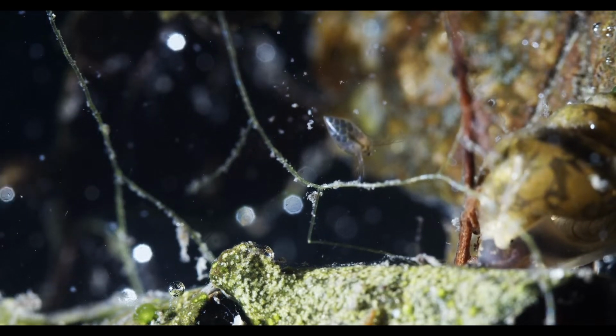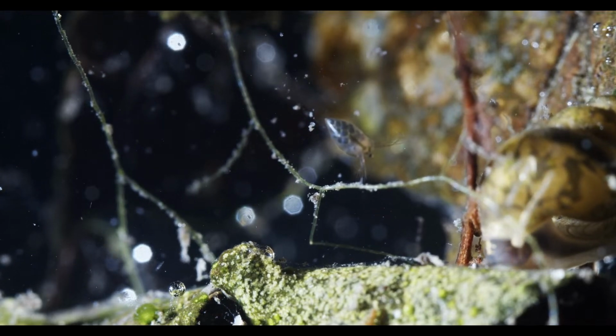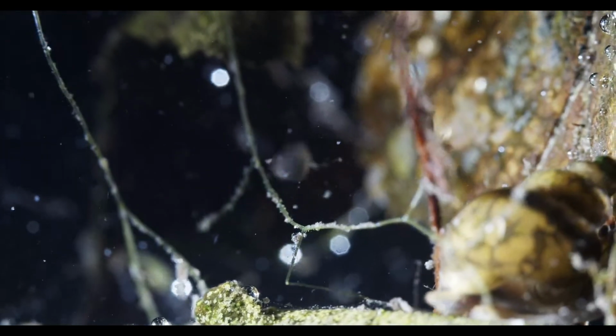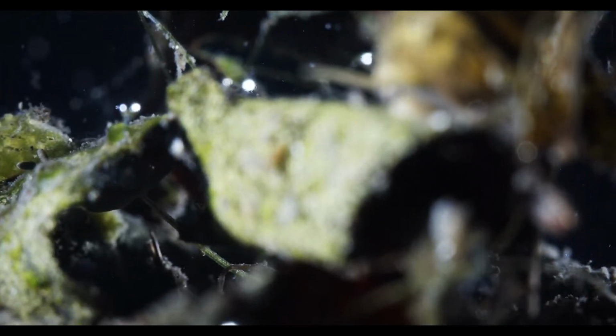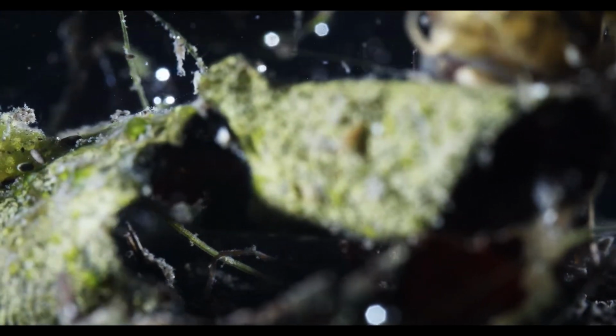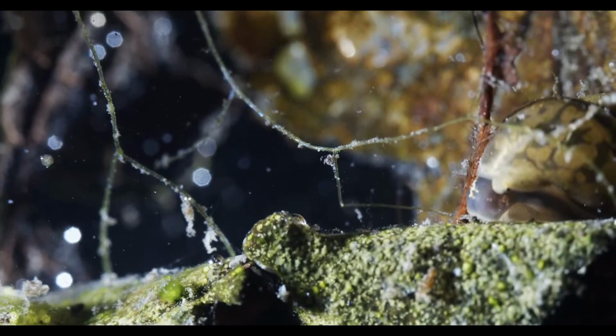7mm copepod. Oh my god. Where are you at, gecko guy? Are you in the States? That is massive. Must have been near a nuclear plant or something, right? No, I mean, I know there are some bigger species.